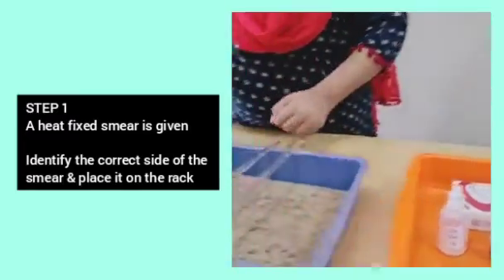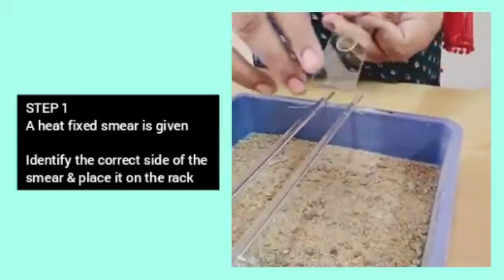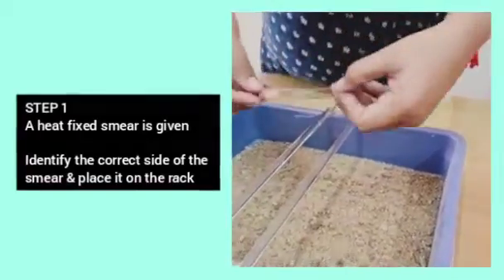Step 1. Now, a heat fix smear is given. Identify the correct side of the smear and place it on the rack.